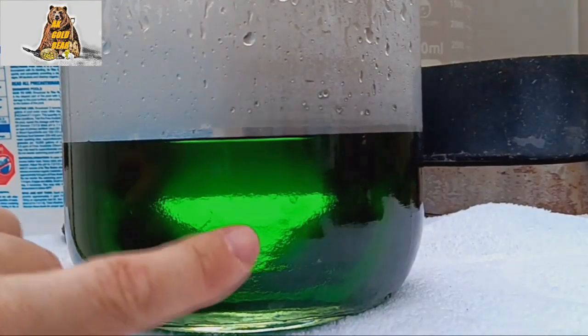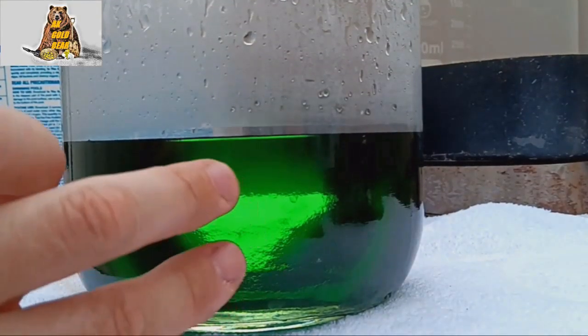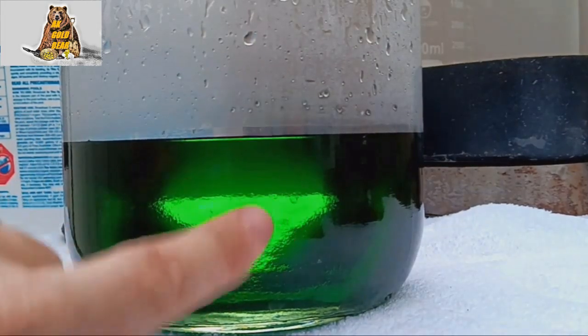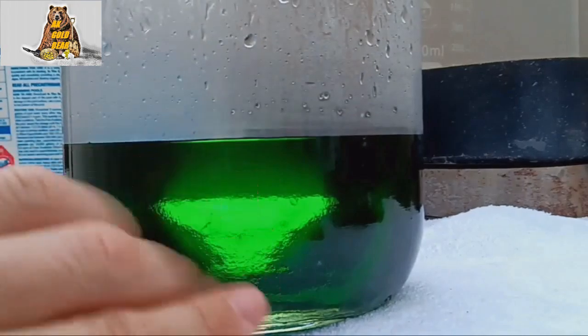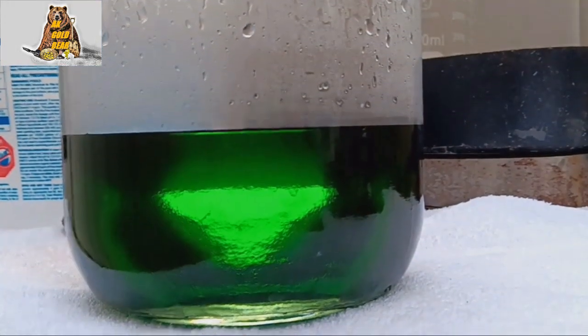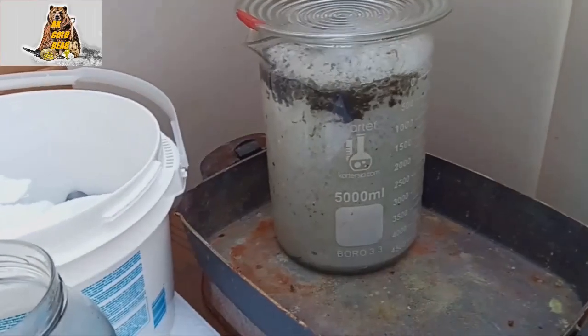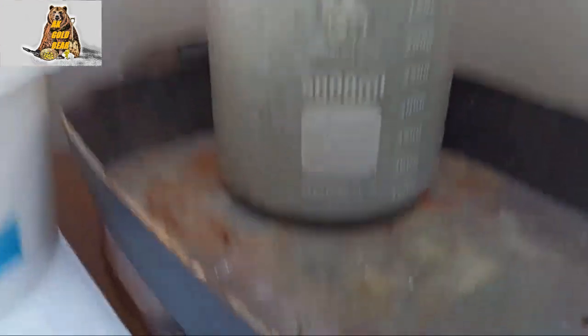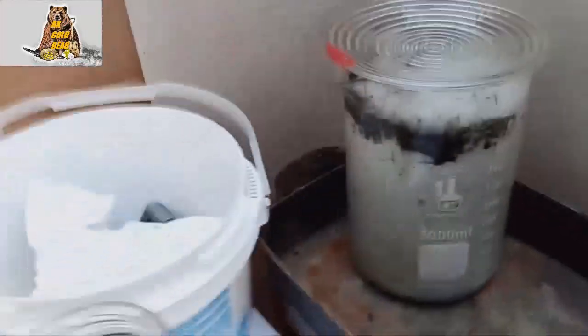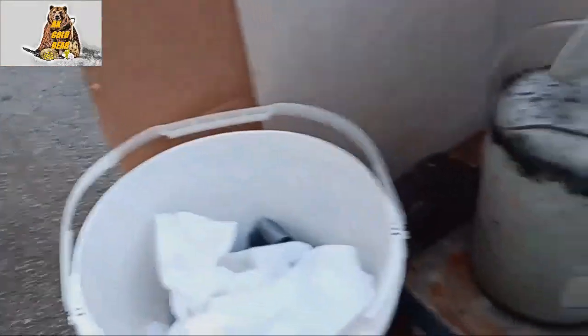Okay guys after second filtration my solution looks much better. It's still dark but you know if you have same problem don't worry, it's absolutely no problem. That's what I'm talking about, sometimes reaction too strong. See, okay.